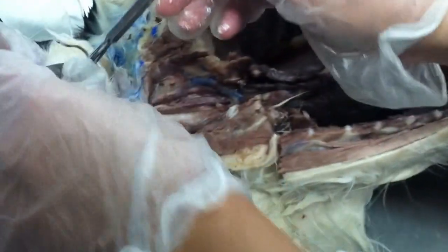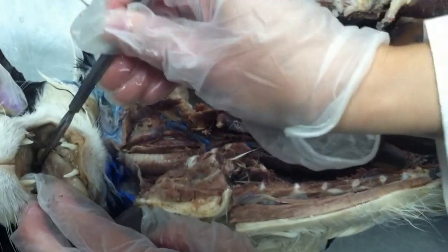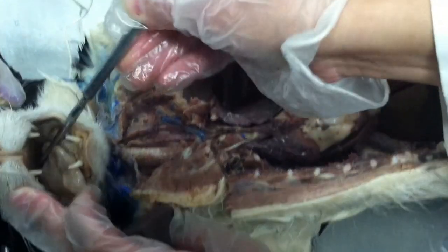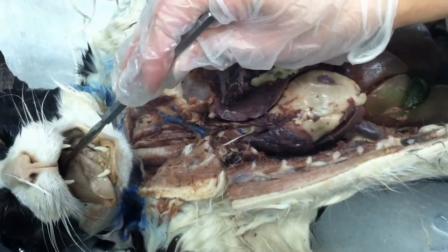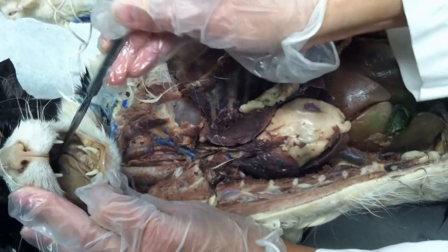Soft palate, right? So this is the hard palate, and the soft has no fold. Wait, so the top is the hard palate? Yes, all right? The lower part is the soft, and it has no fold. Where's this lower part? I can't see where you're pointing. The lower part. Do you see it now?